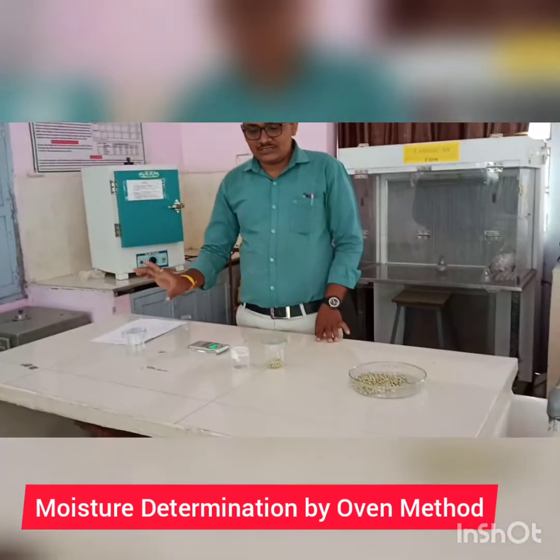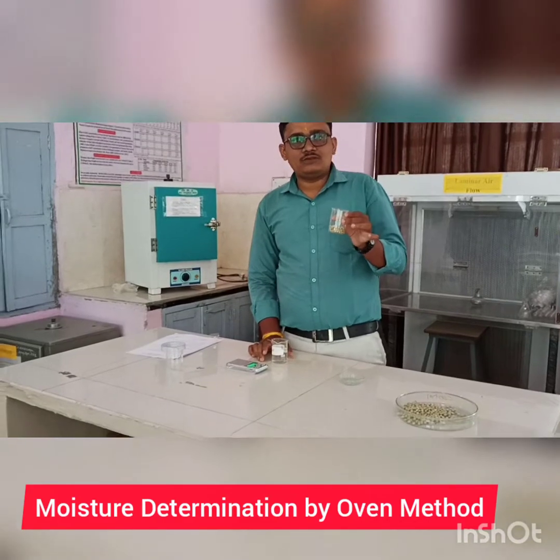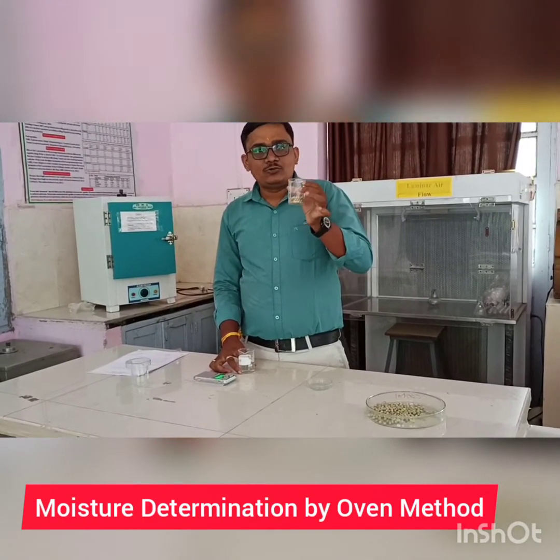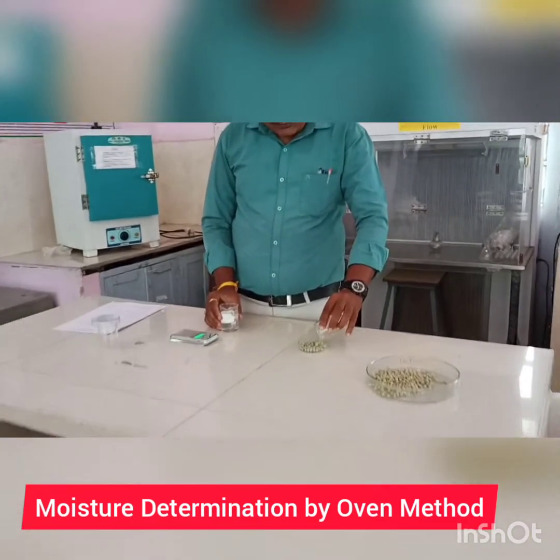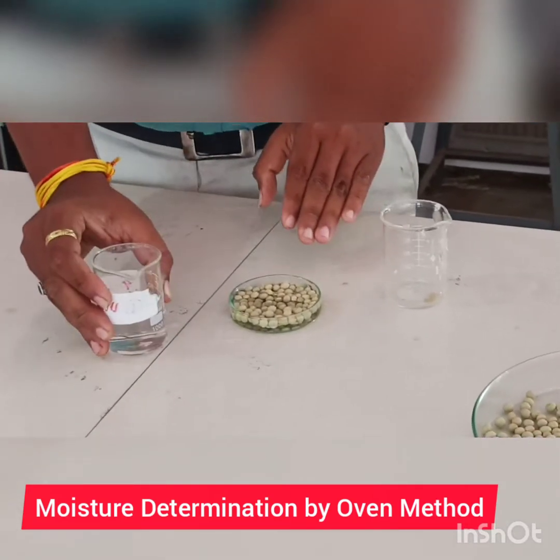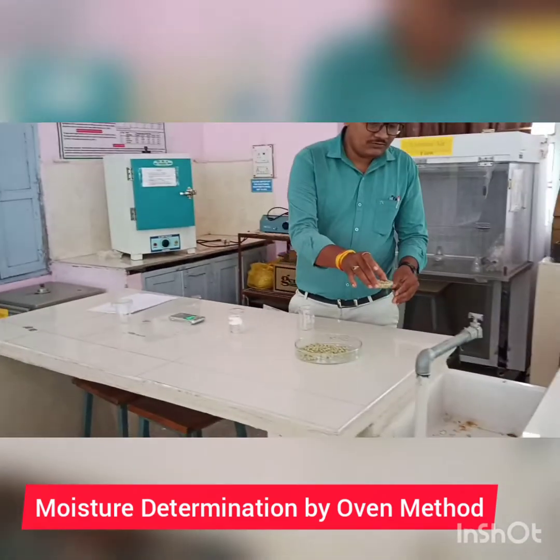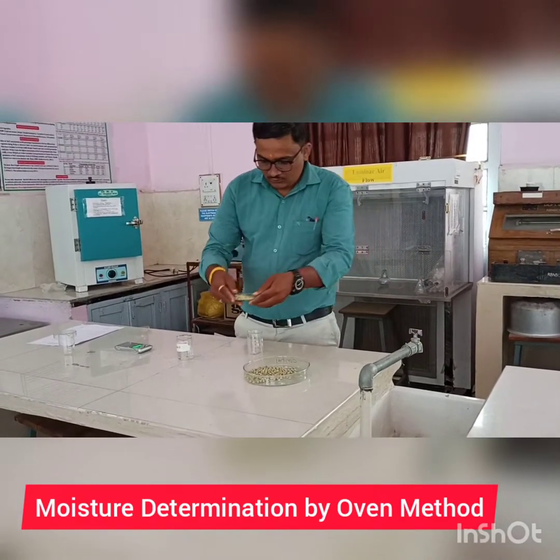Then we take the weight of the seed sample. Seed quantity is based on the prescribed standard. For moisture determination in a leguminous plant, the prescribed standard weight is 20 to 30 seeds. We take those seeds in a petri plate. The seeds are wetted with the help of water and remain for five minutes. After five minutes, water is removed from the seeds.